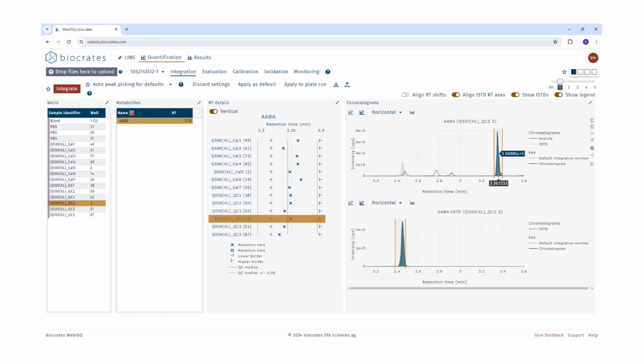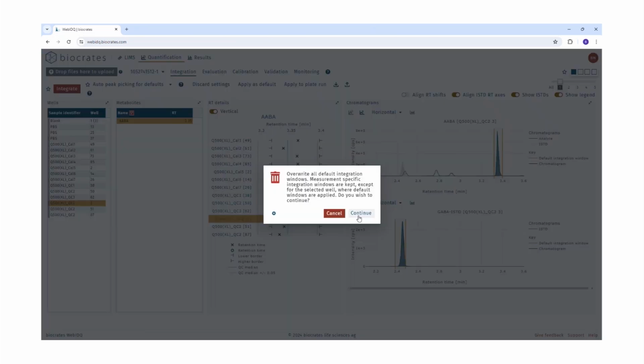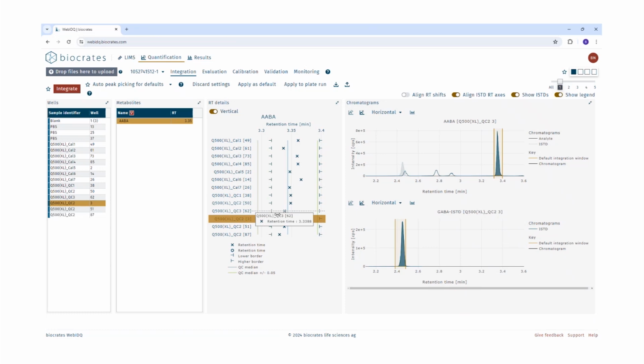So once you have made all the adjustments, you can click apply to plate run. And these default RT windows which are plate run dependent will be replaced by the ones from the currently selected well. Click on continue. You can see that after applying to plate run, all the samples will turn blue, indicating that they are using default retention time windows. The default retention time windows are plate run specific. If you want these settings to be automatically applied to the next plate run, you can click on apply as default. So after talking about tips and tricks, now it's time to talk about magic.